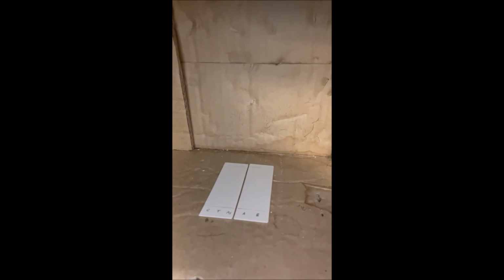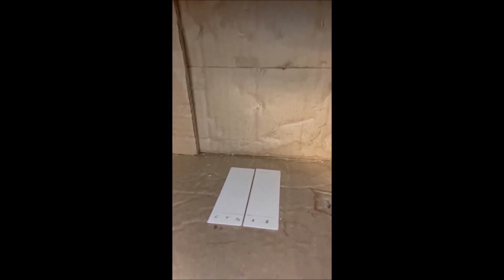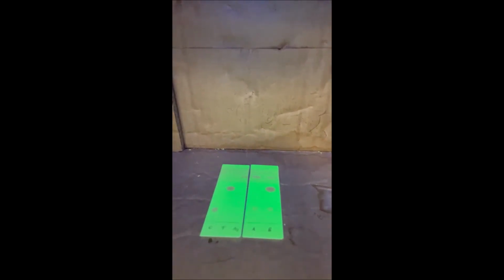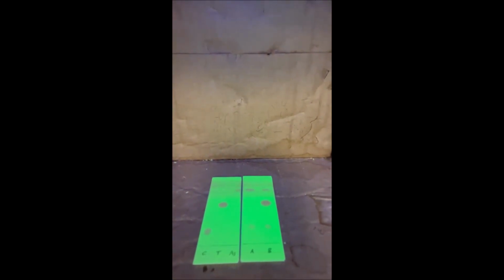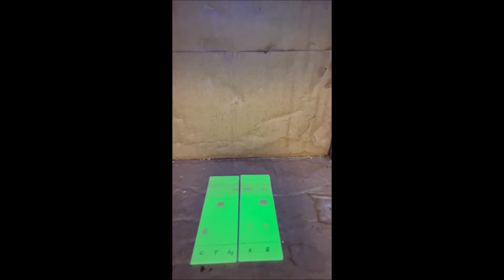All right, so these are the 2 TLC plates that I've run through the TLC chambers and under the UV lamp, all right? Remember what they looked like before? Well, this is what they look like now. You can see that those spots are still there, but can you guys see that they have moved? Those spots are all in different places. And the position of each spot gives us a good idea of being able to tell what exactly is what.